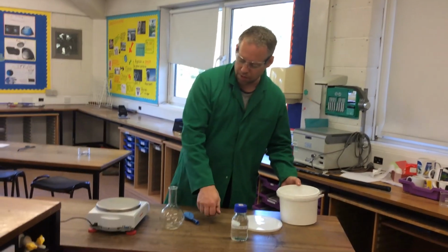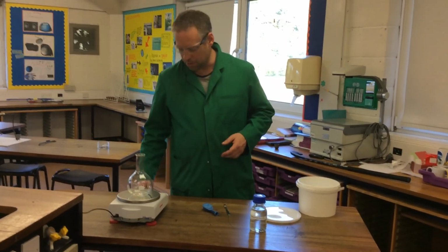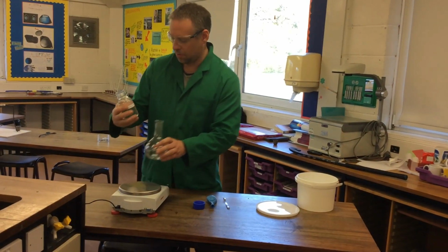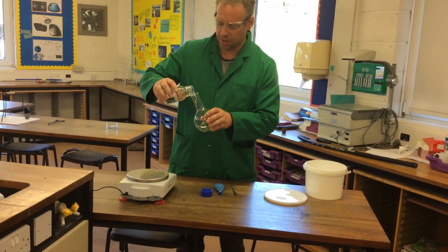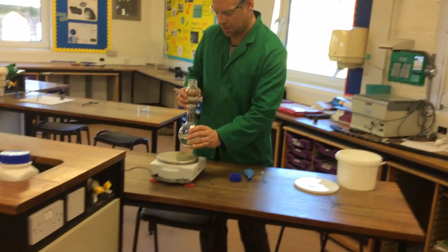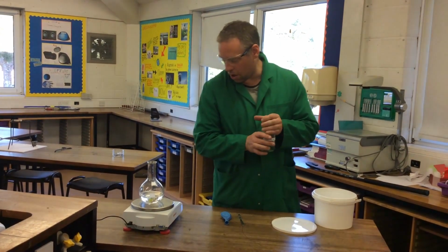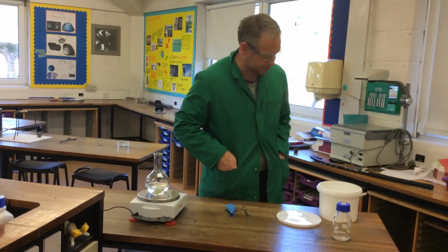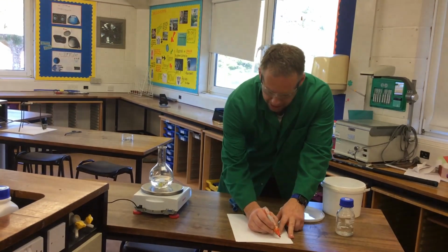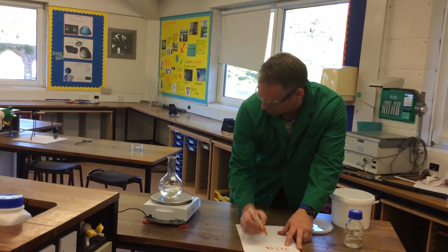For this experiment, I've got a flat bottom flask that I'm going to put onto here, and I'm going to add some, what have I got today? Sulfuric acid? No, hydrochloric acid we found in the cupboard. I'm not going to worry about exact amounts because it's not that precise an experiment. That gives me a reading of 325.06. So I'm going to write that down on a piece of paper. I've got it here to the side. 325.0, it's gone down to 0.4.